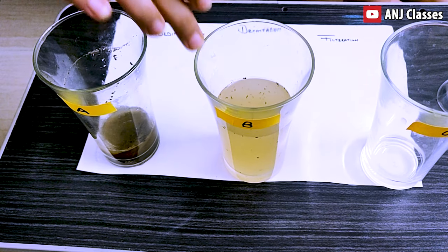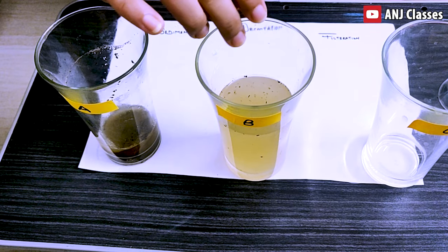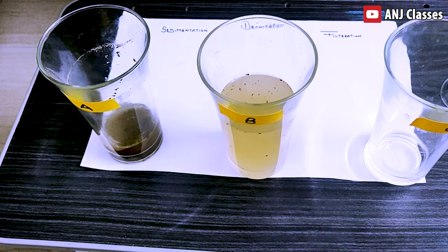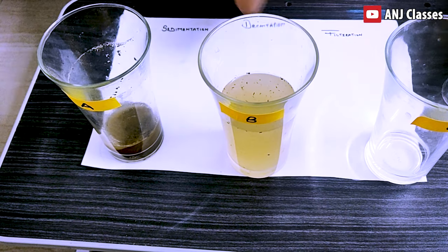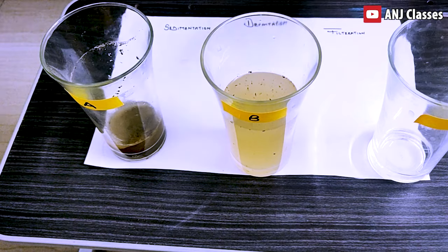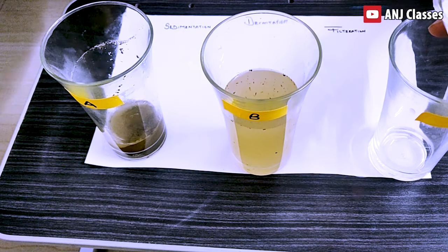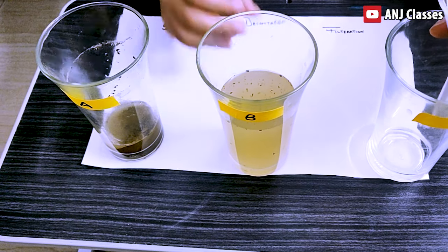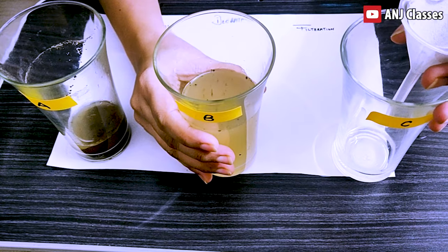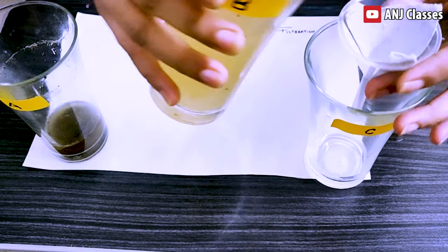Now we will pass this decanted water through filter paper. I will make a simple cone of the filter paper and we will put the decanted water through it into a glass.